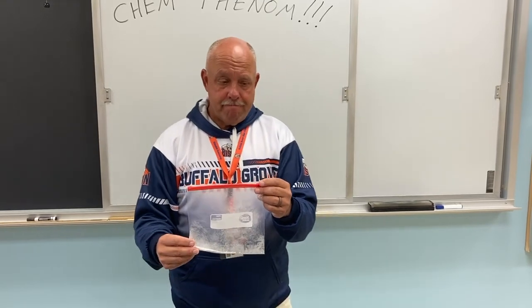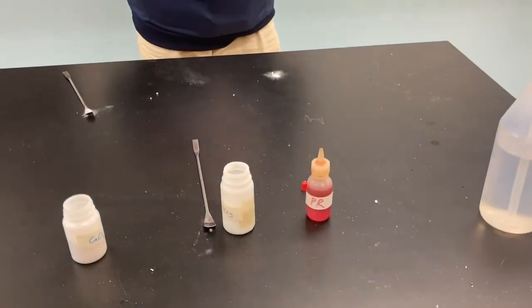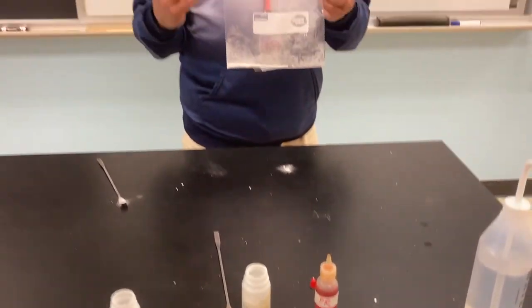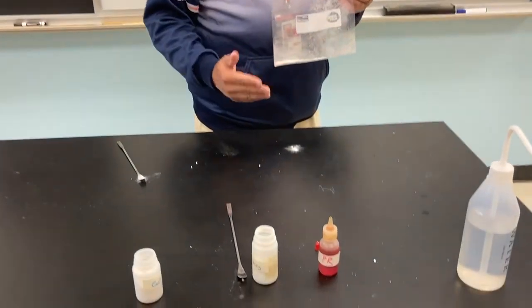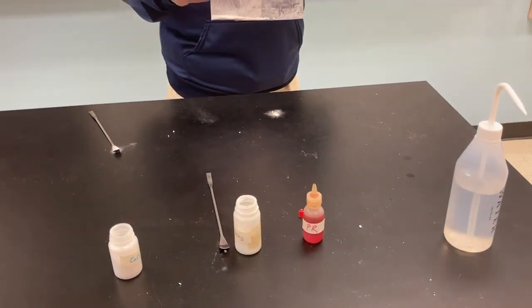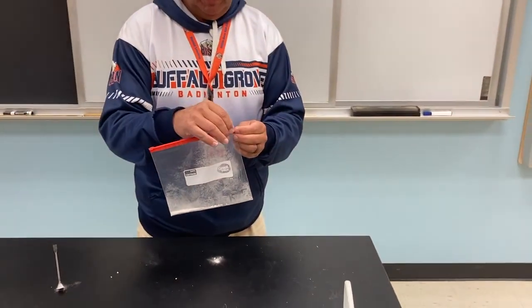So, all right. Now, Mr. Van Grandel, we have two solids there that we don't want to waste as scientists. What can we do now? What if we've already combined the phenol red with these guys and saw what happened there. What if we did part of the phenol red, which was actually the water part? Oh, so just the water, not the phenol red. Yeah. Well, we happen to have a water bottle right here. Let's take a look. Let's see what happens.